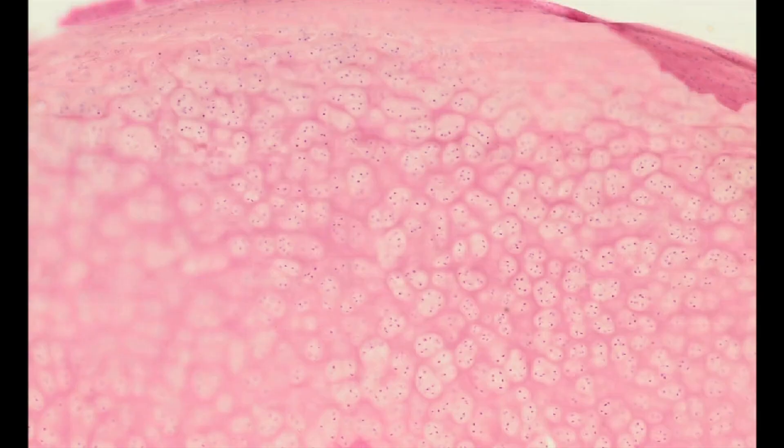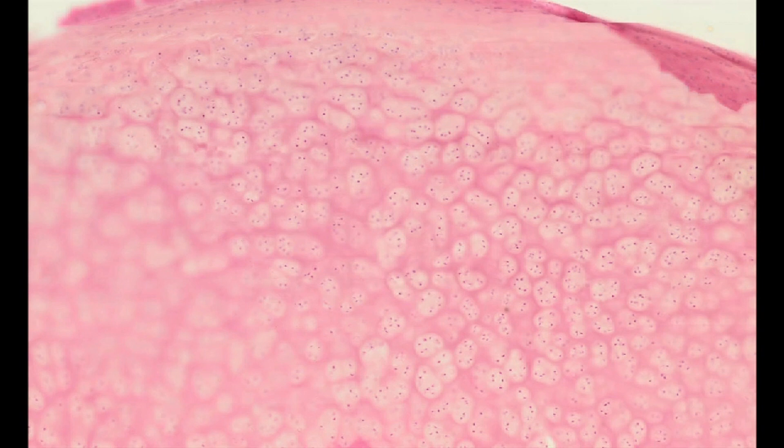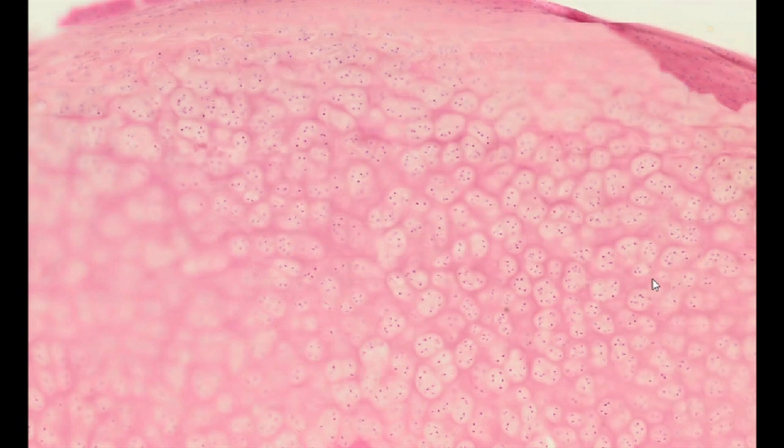Hyaline cartilage, H&E staining. The specimen shows hyaline cartilage, the most common cartilage in the human body.